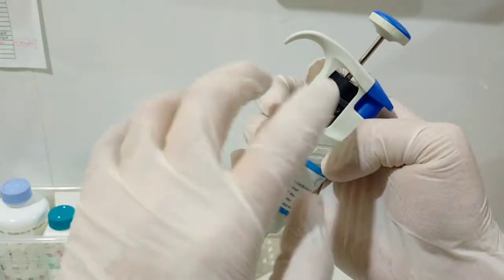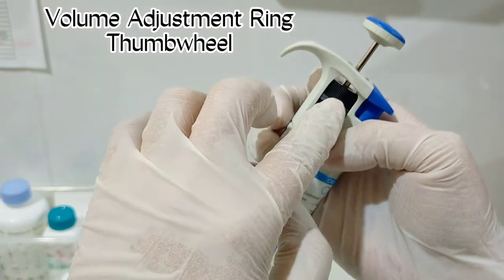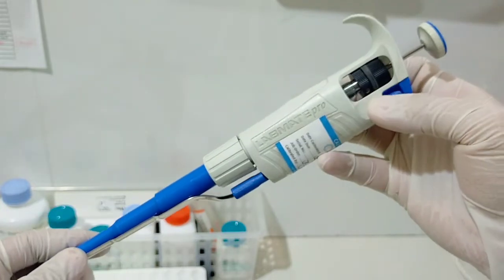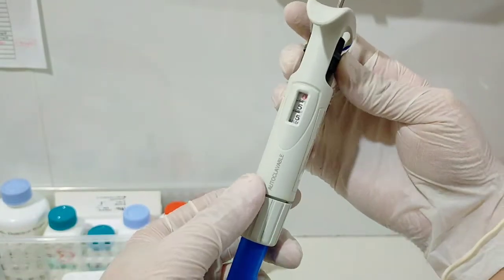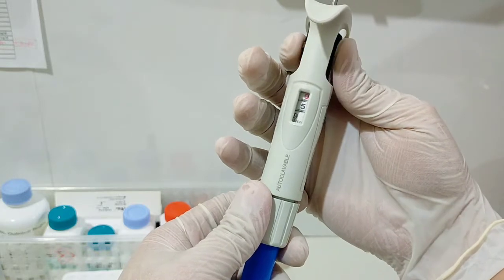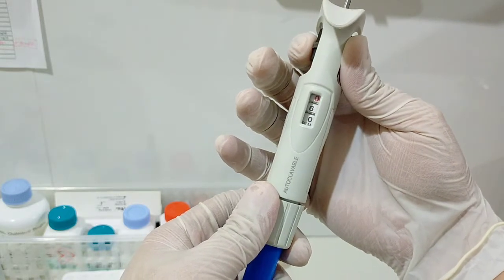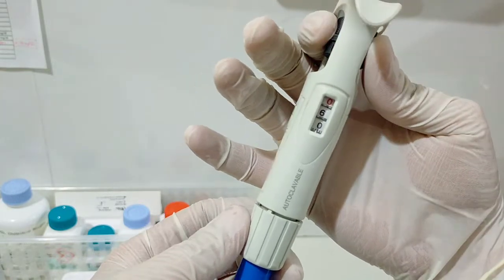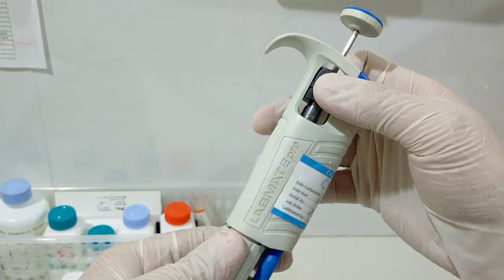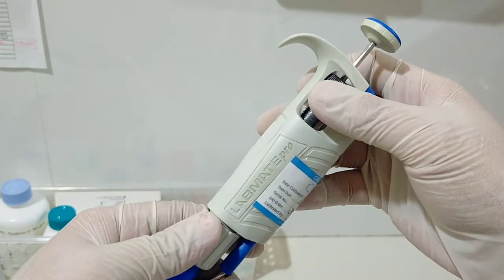Next, we have the volume adjustment ring, also called the Thumbwheel. It is used for volume transitioning. For example, I will change the volume to 600 microliters. As you can see, the transitioning was made using the Thumbwheel or volume adjustment ring.